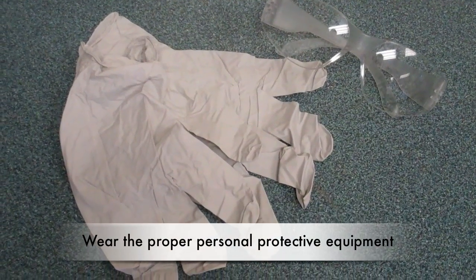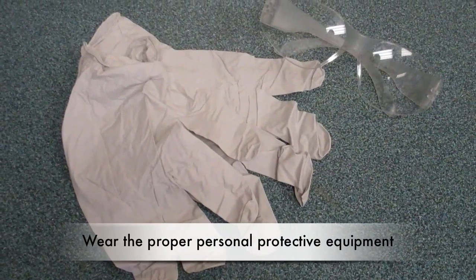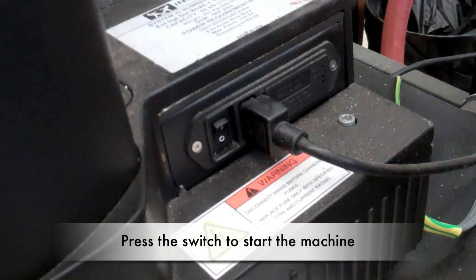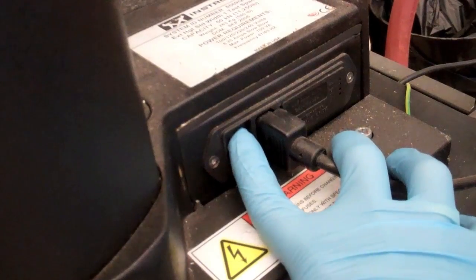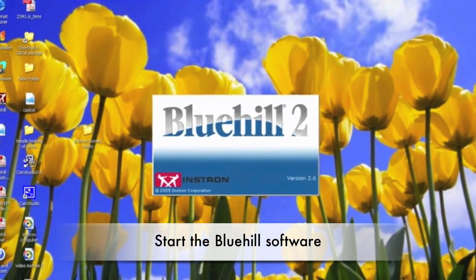Make sure to use the proper personal protective equipment, including goggles. To start the machine, press the switch on the back right side. Do this before starting the software because the Bluehill software is synchronized with the machine.